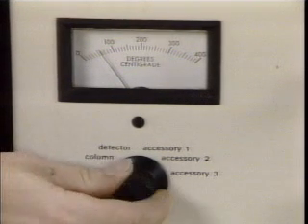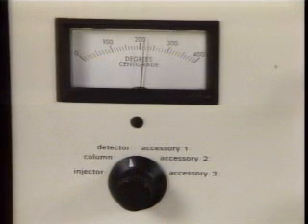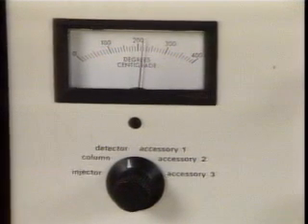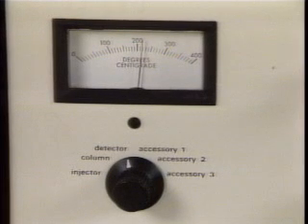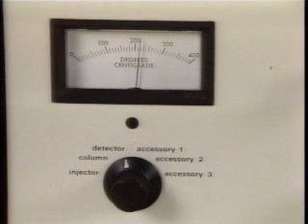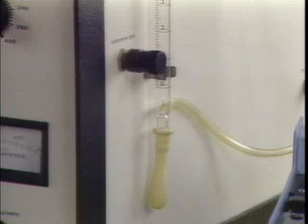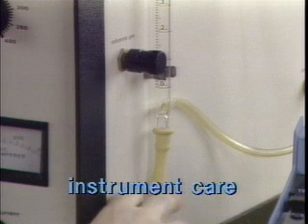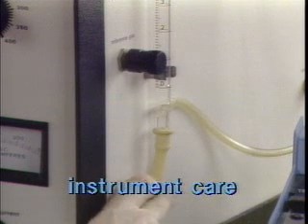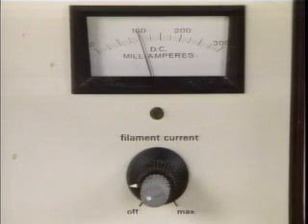Chromatographs with thermal conductivity detectors have a third temperature control that regulates the temperature of a resistance wire in the detector. The temperature of this detector is normally set according to the manufacturer's or instructor's directions. It is usually a function of the instrument rather than the sample. Before turning on the filament current in the detector, make sure that the carrier gas is flowing through the instrument. Otherwise, the filament current may burn out the wire.